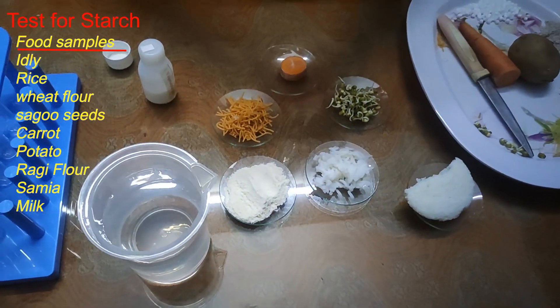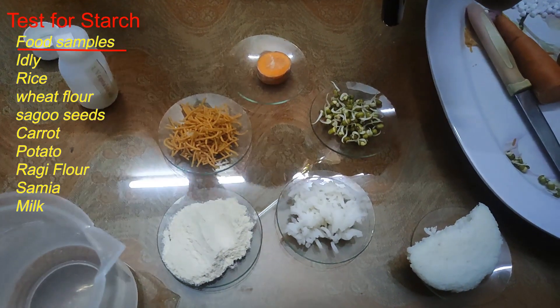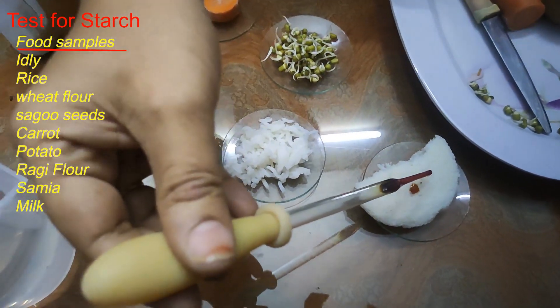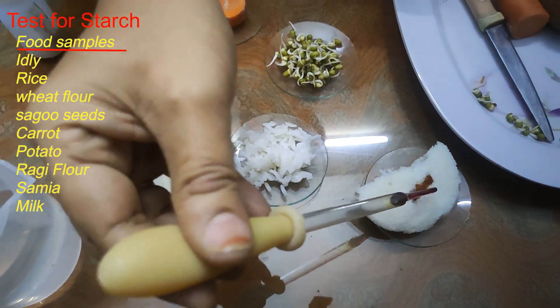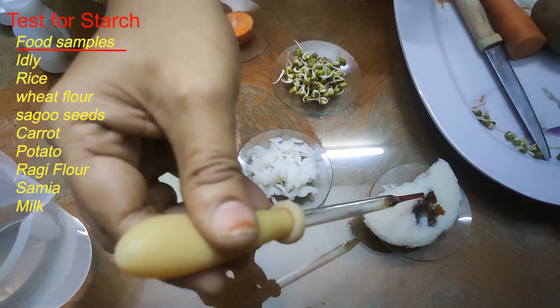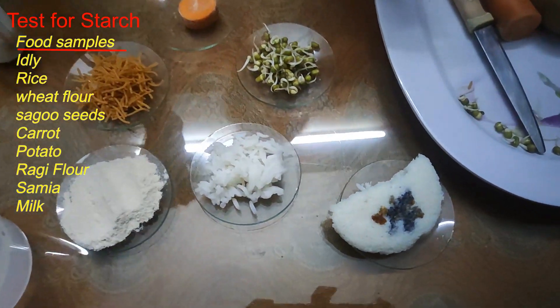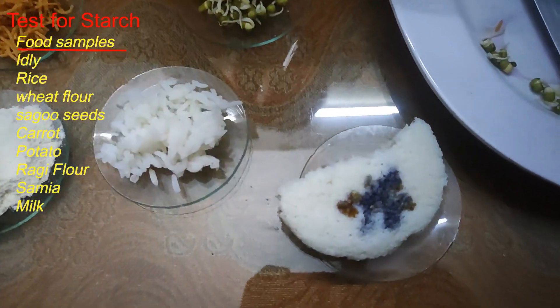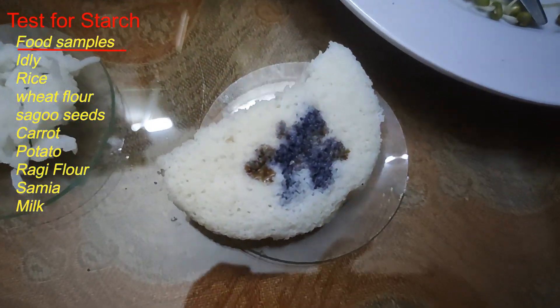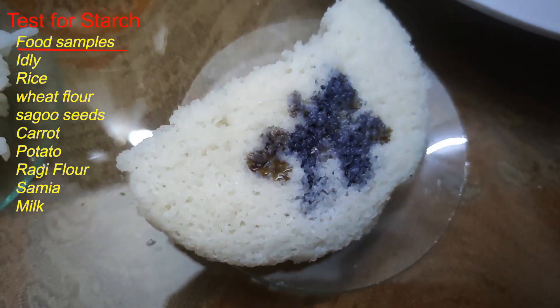I am adding drops of iodine one by one onto each food material. I am adding a few drops of dilute iodine on idli. It changes to black color. We can observe the color change.